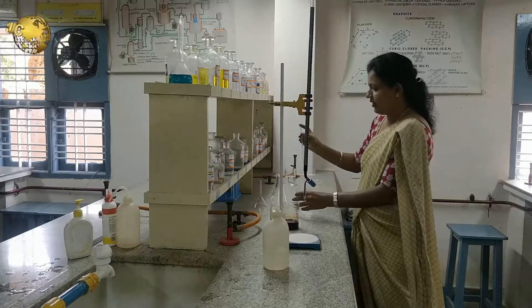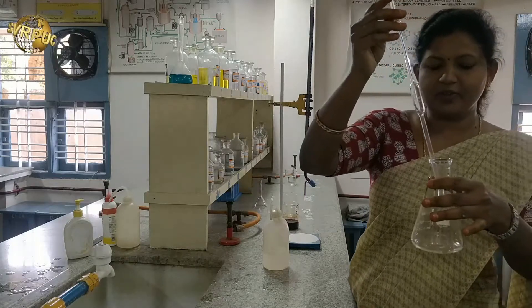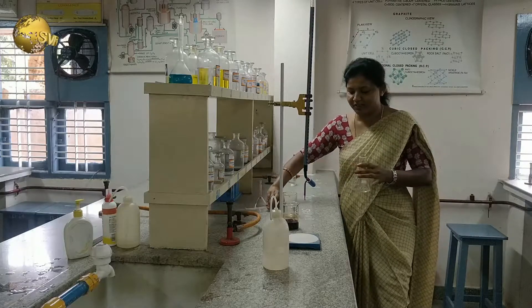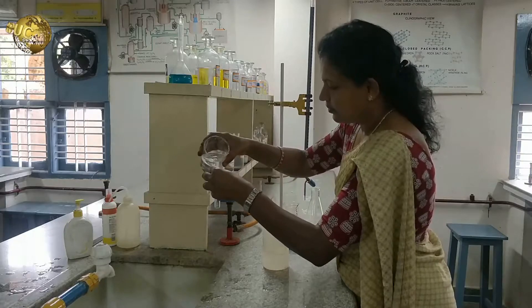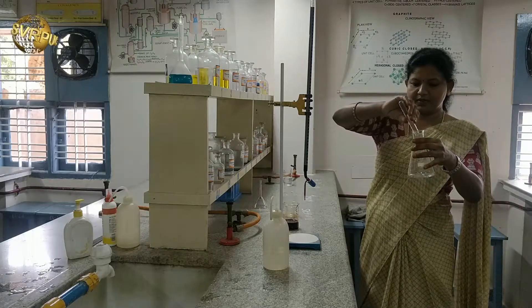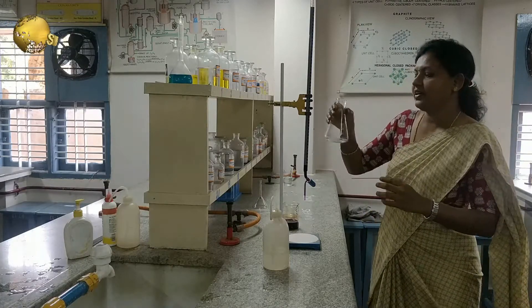We transfer the ferrous ammonium sulphate into a washed conical flask. While transferring, the pipette tip has to touch the bottom of the conical flask so the entire solution goes in. After transferring 10 ml of ferrous ammonium sulphate, we take one full test tube of dilute sulphuric acid and add it to the conical flask.